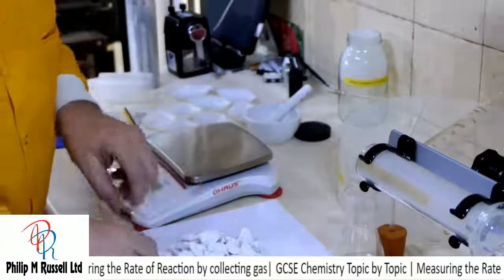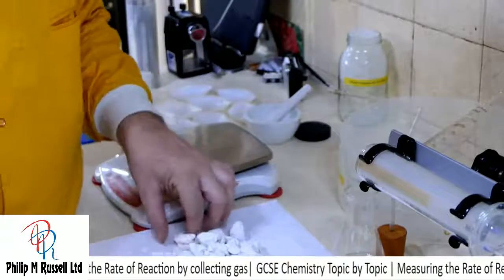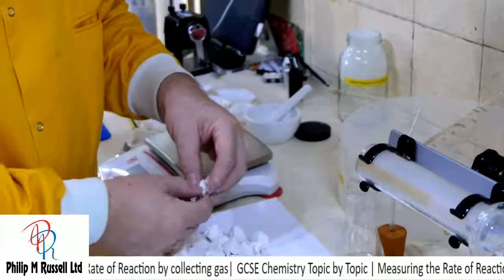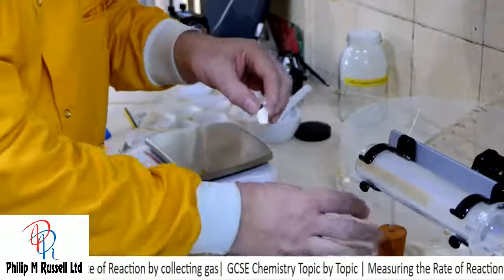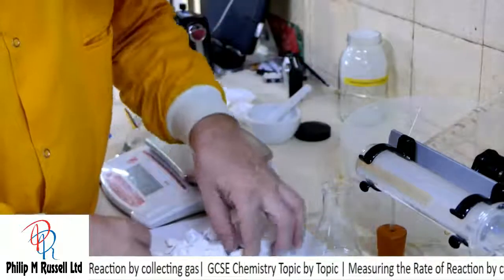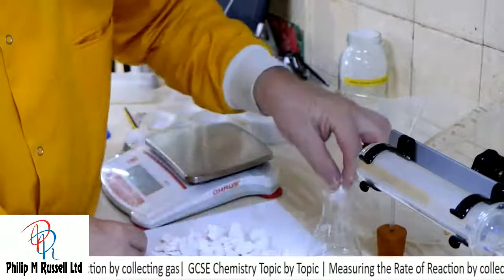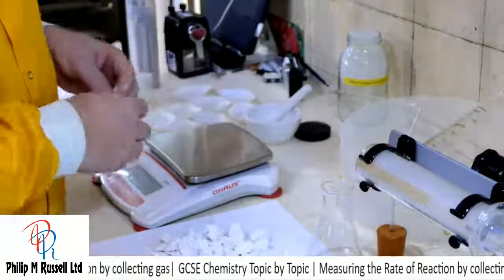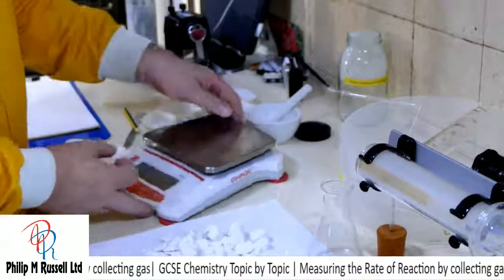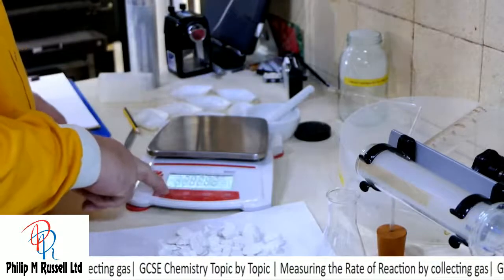And I want a reasonable lump. When I'm looking for a reasonable lump, I'm looking for something that is fairly easy to get in there, and I don't want to go too big on the lumps. That would work, I suppose. Let's turn the balance on and we'll have a look and see what we've got.